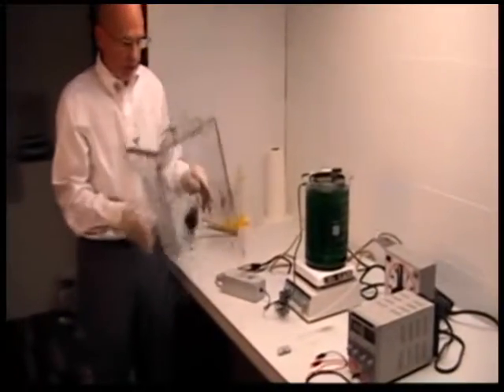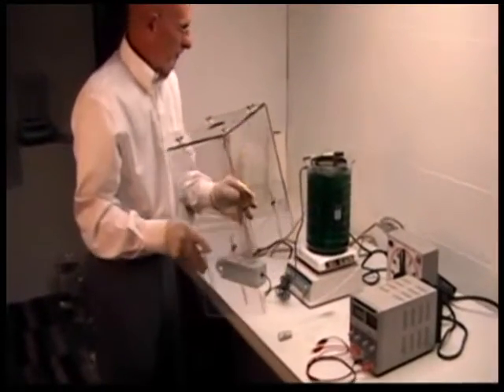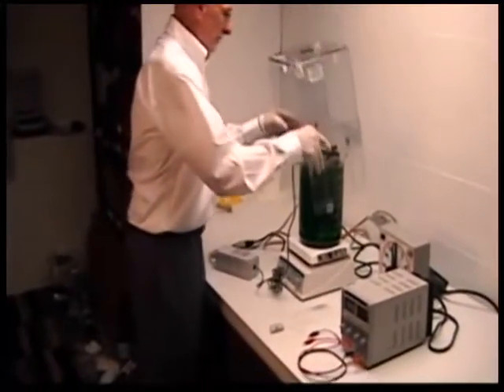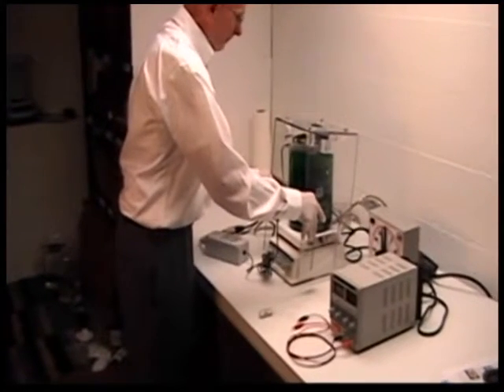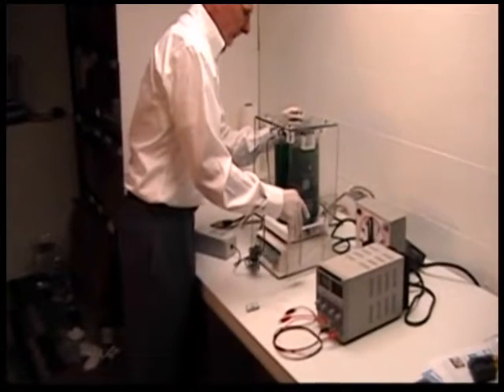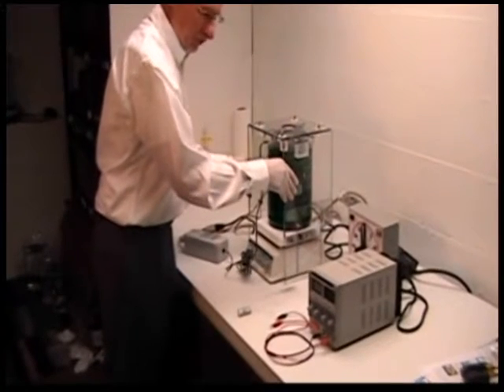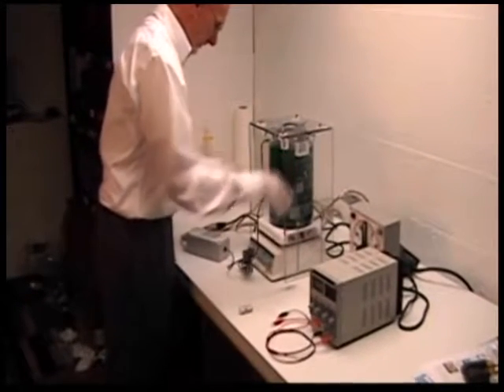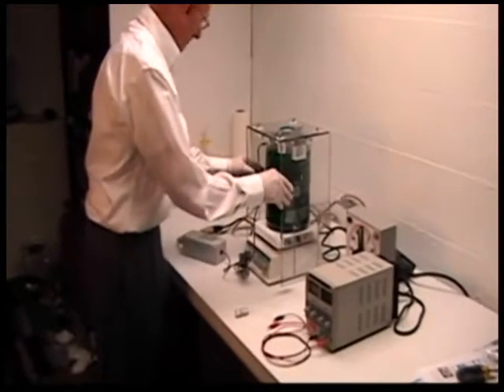This is a self-centering stand for height and to center the helix in the plating bath. It's sitting over top of the beaker. It's adjustable to fit any size beaker that holds 4,000 milliliters, any design of that beaker. Everything is centered.